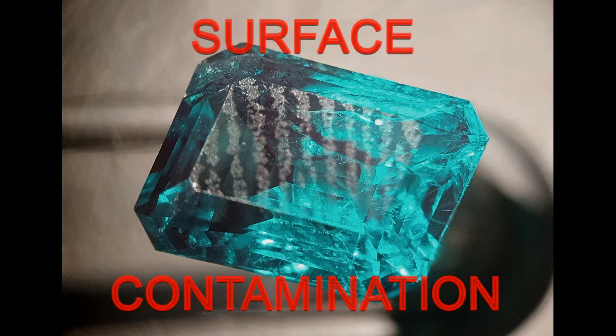Before starting to operate, it's always important to remember the stone must be as clean as possible. External contamination, commonly from fingerprint oil, can affect the spectrum of our sample, and for emeralds this is particularly problematic since the contamination peaks overlap the area where organic fillers are detected by FTIR.